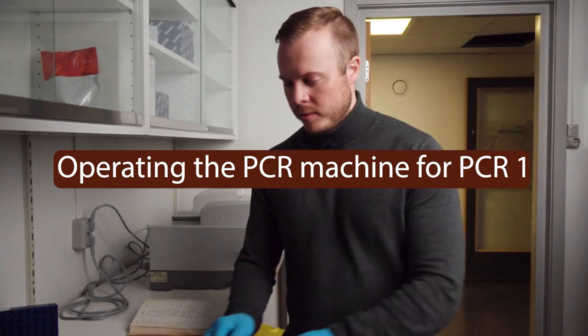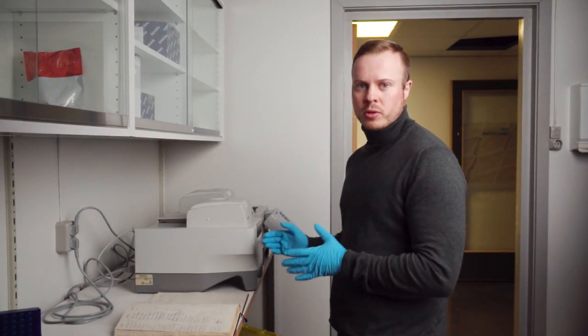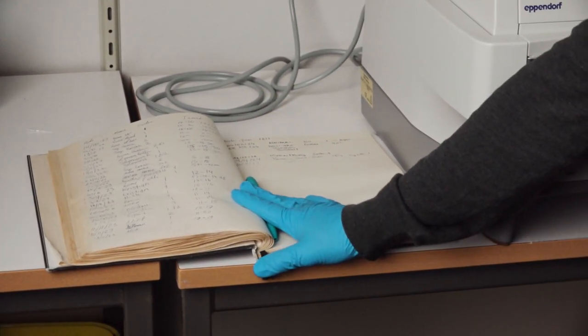Now we have arrived at the second lab room where we have the machines that are doing the PCR reactions for us. But even before we start, it's very important that we use this book and write the date, the name, and the time.